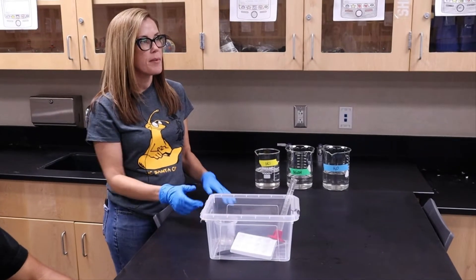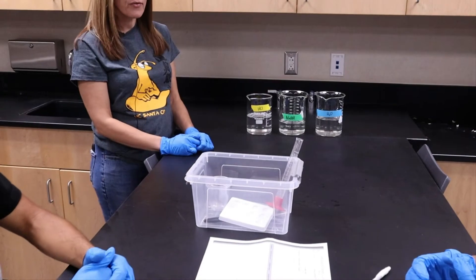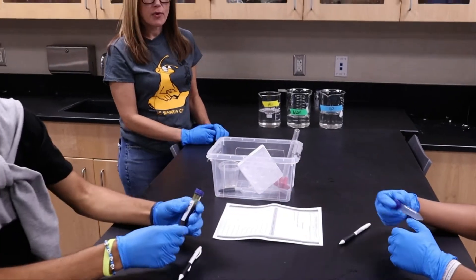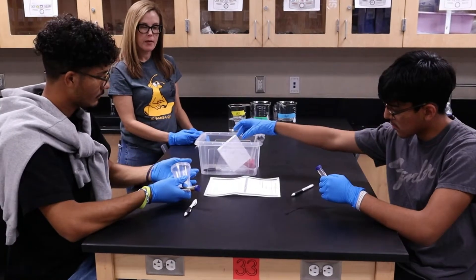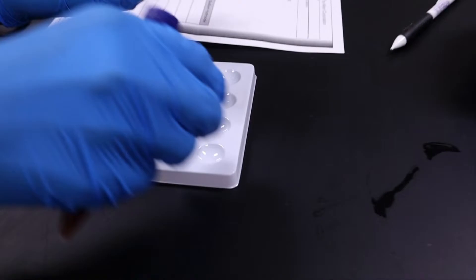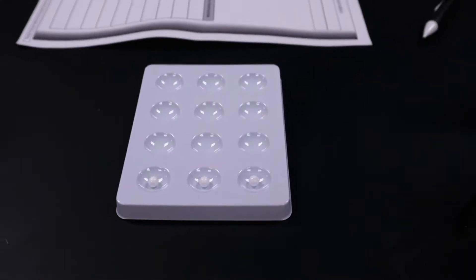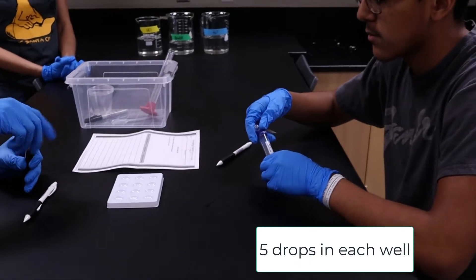We'll start by the students retrieving the shellac and the sodium alginate from their student buckets. Retrieve the three plastic beads and put them in separate spots on the well plate. Then, using one of the squishy pipettes, add five drops of shellac to each of the three wells containing the bead.